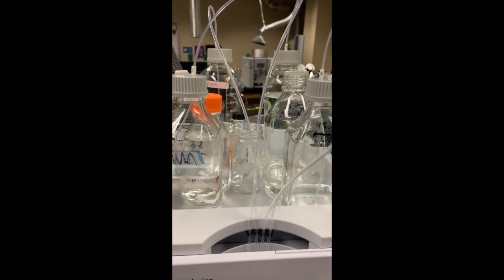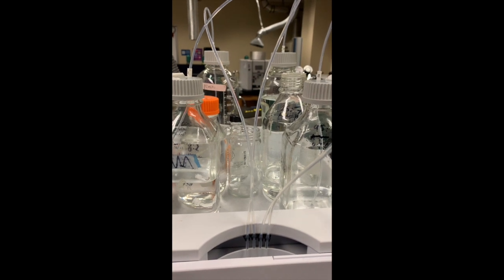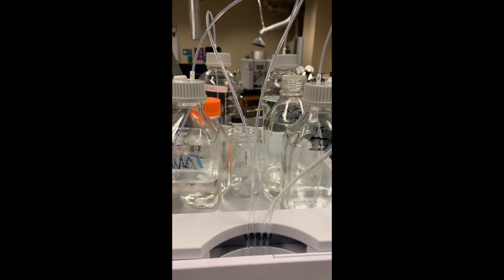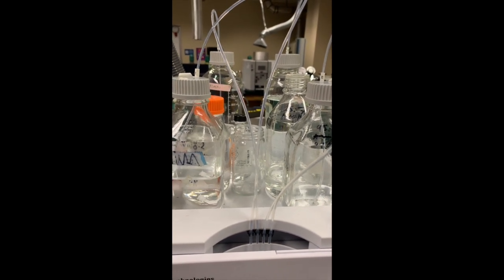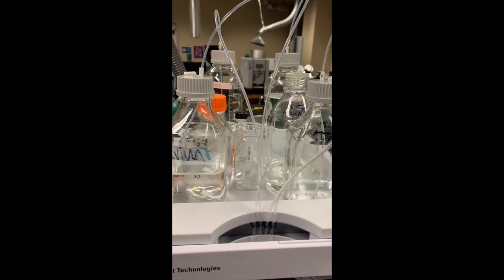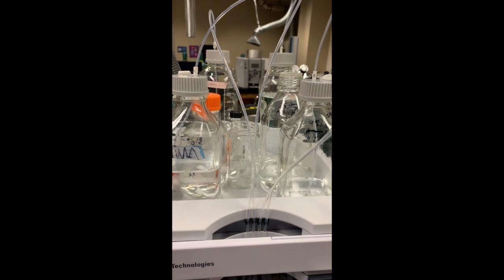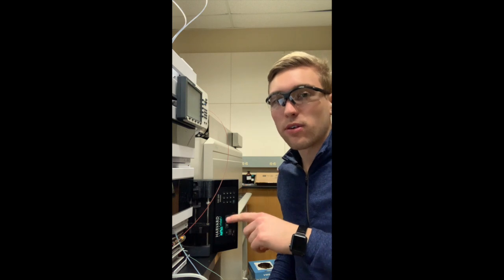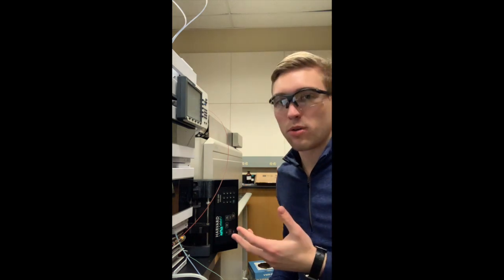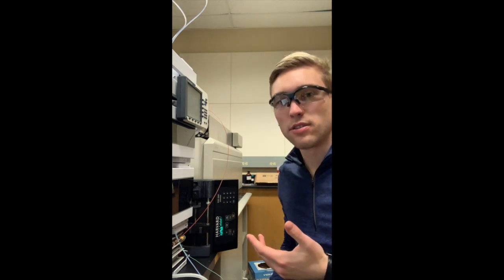It's important to remember to use only HPLC or even mass spec grade solvents in these solvent systems or else it can gunk up the mass spec. Now if you're running this column for the first time in a while it's going to be important to get it re-equilibrated to the solvents that you're using. This is always a good idea anyways.